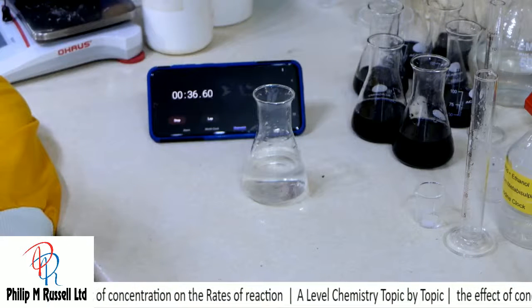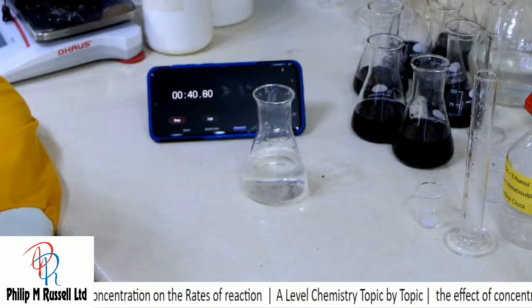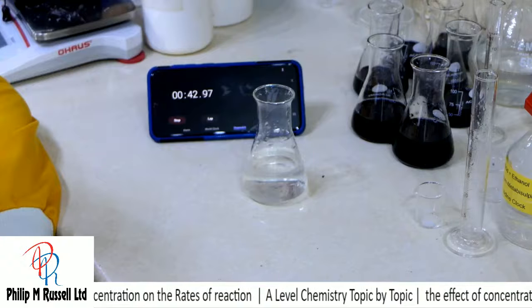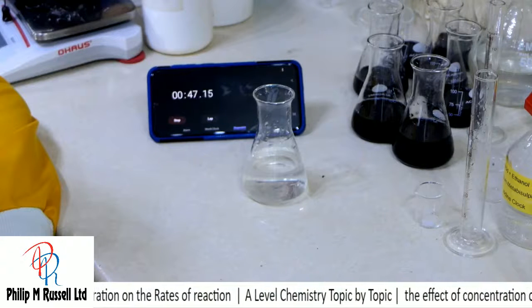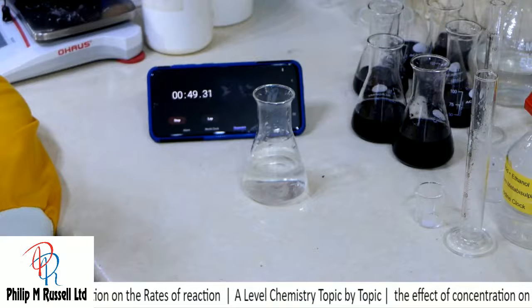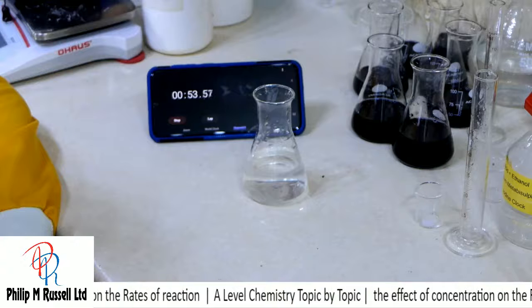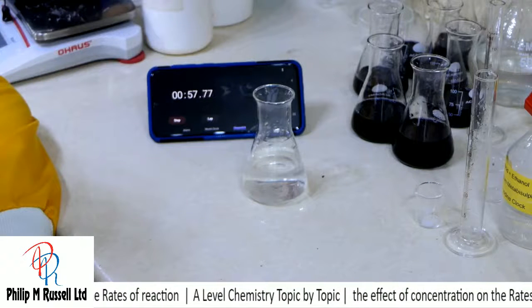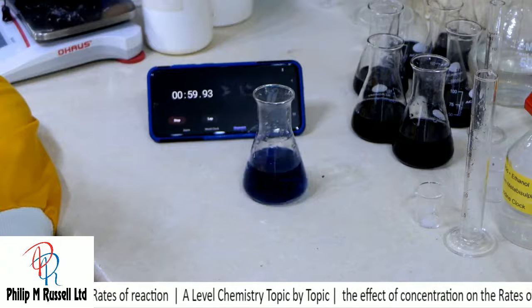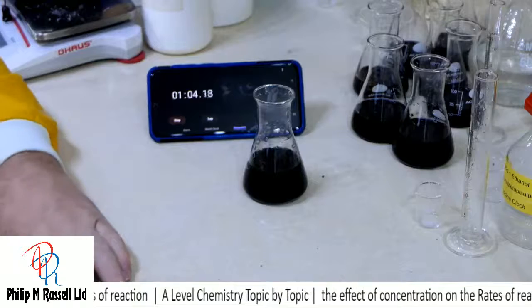And I get a kick every time how this suddenly goes. Here we get ready. One over T, remember. And virtually at 60 seconds.